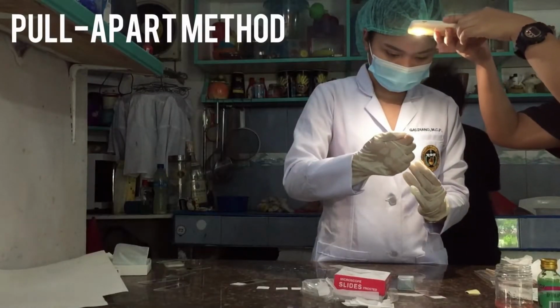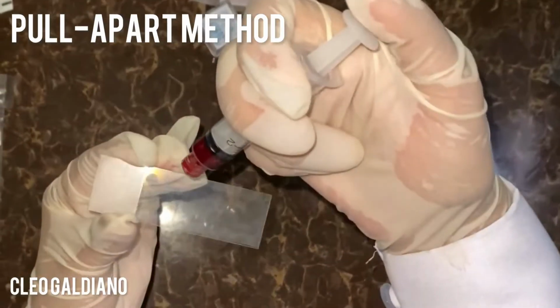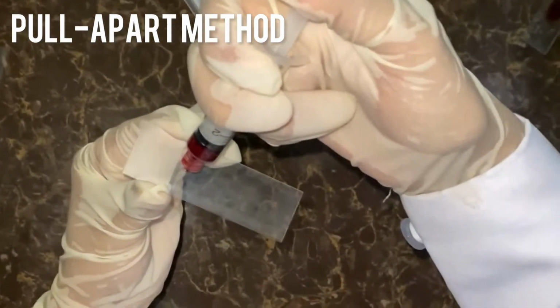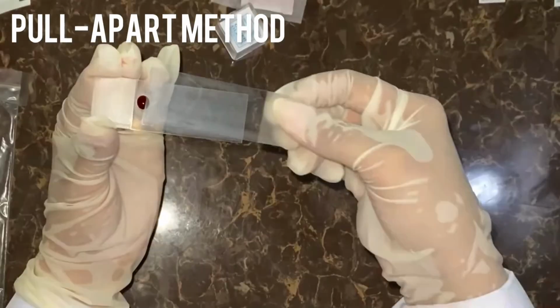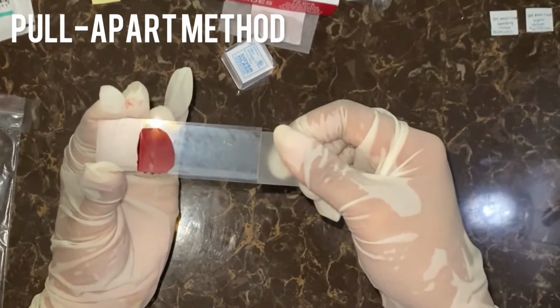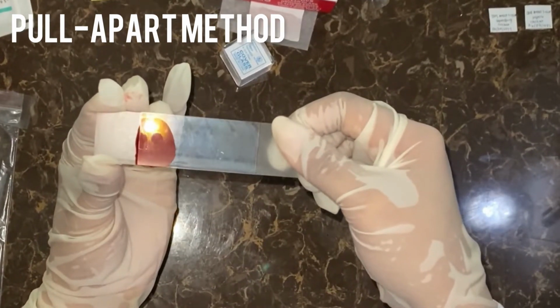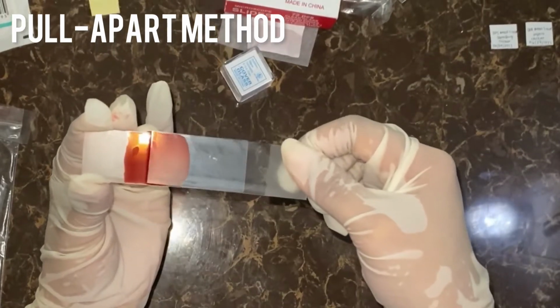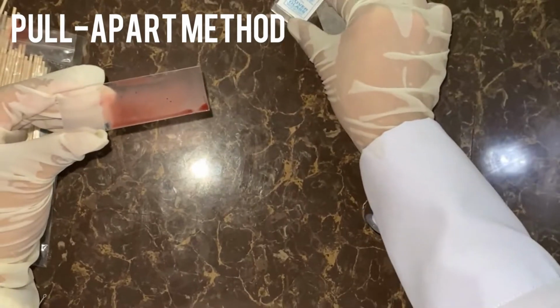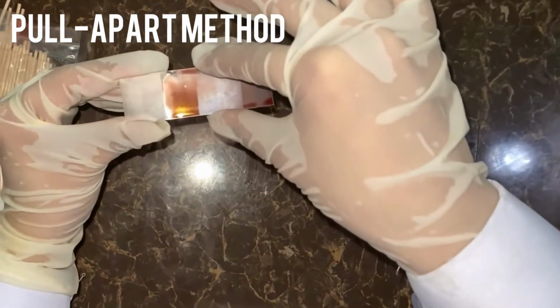Pull apart method. First, place a drop of the sediments at one end of a glass slide. Second, cover it with the end of another glass slide. Allow the sediments to spread evenly between the attached surfaces of the two slides. Third, with a single uninterrupted motion, pull the two slides apart in opposite directions.